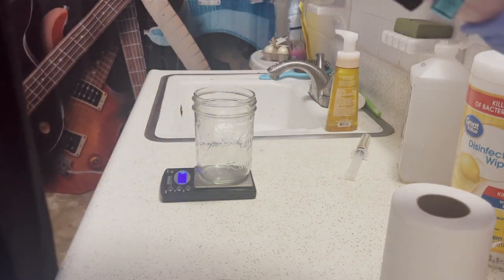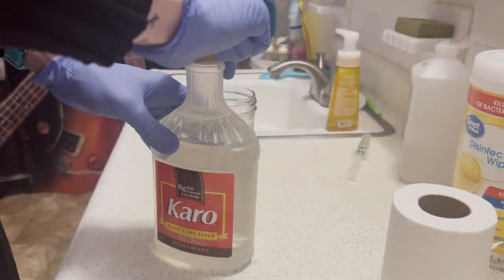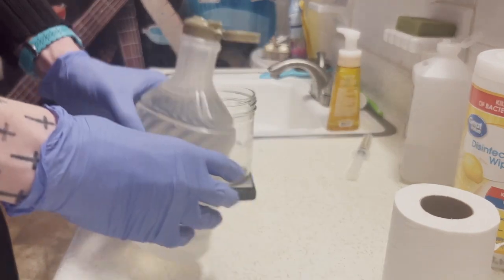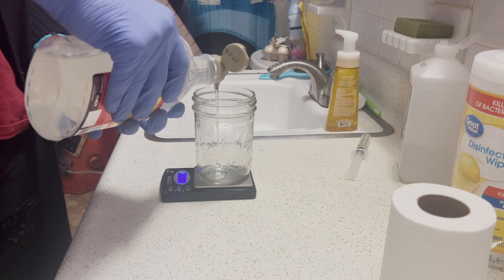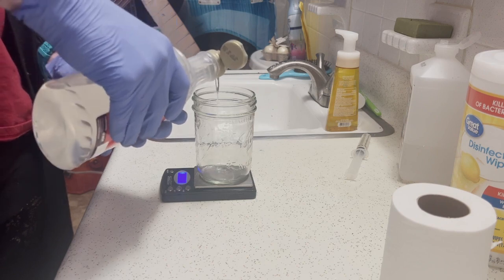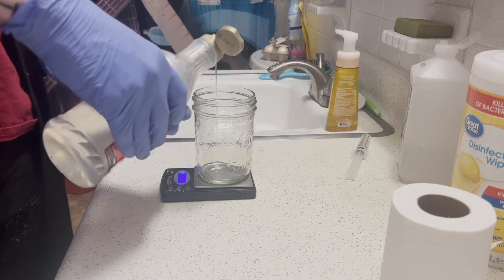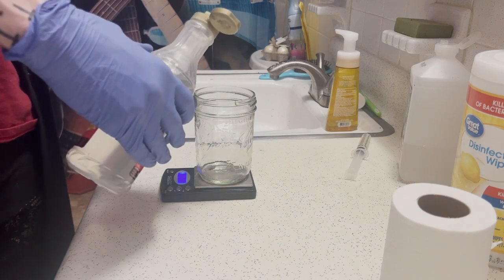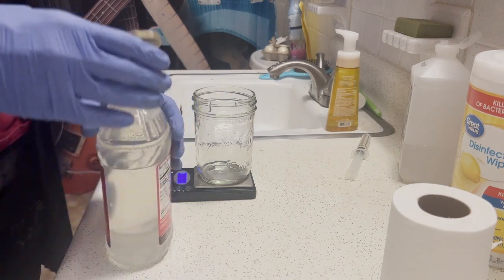I'm taring my scale and measuring out 15 grams of corn syrup — this is just Karo light corn syrup. They all have vanilla in it, so don't worry about that. This is the nutrients that the mushrooms are going to eat off of. I did use a little bit more than 15 grams here, which is okay. As long as you're not filling the entire thing with corn syrup, your culture will do fine. You just don't want it to get smothered by too many nutrients.